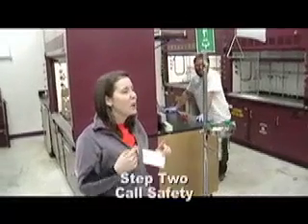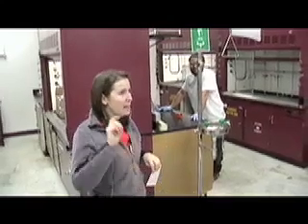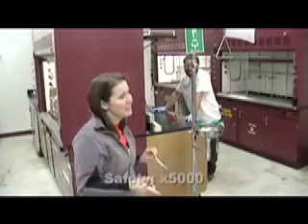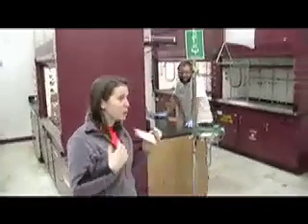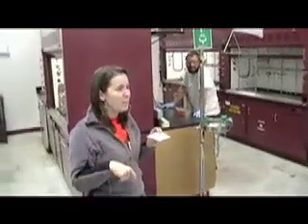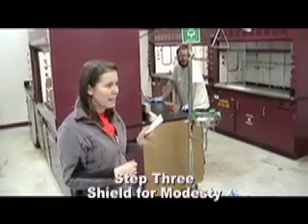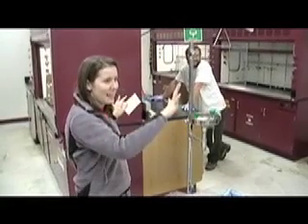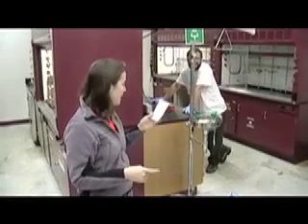Now, you also want to call for assistance. So if someone else is in the room with you, you want to see them, point at them and be like, you, call safety. And if you're in the room when this happens to someone, you should call safety. And then you should maybe be a nice friend and go get a lab coat or a towel. You could use it to shield them for their modesty's sake, and then you can let them be dry afterwards. And contain the spill.